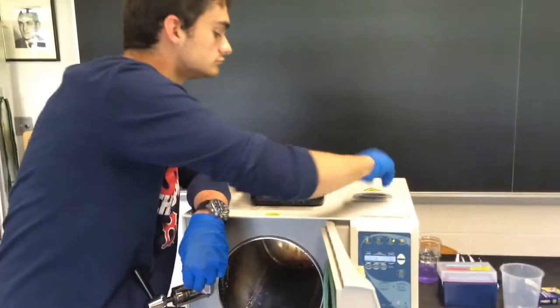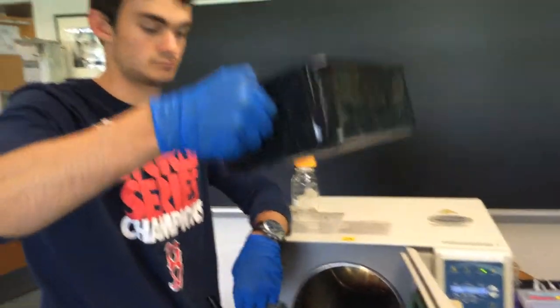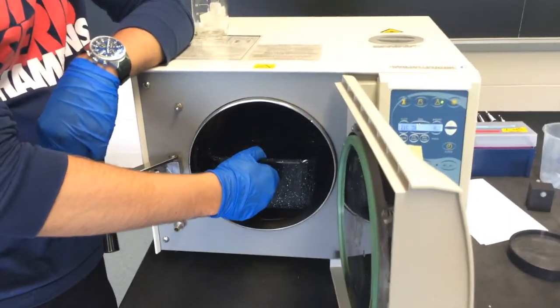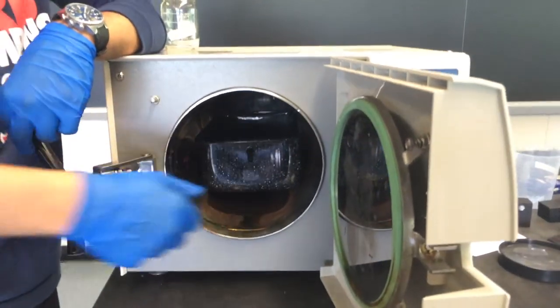Always use a tray. When you put some liquids in there, you want to make sure there's a tray so the water or the contaminated liquid doesn't go back into the system of the autoclave.